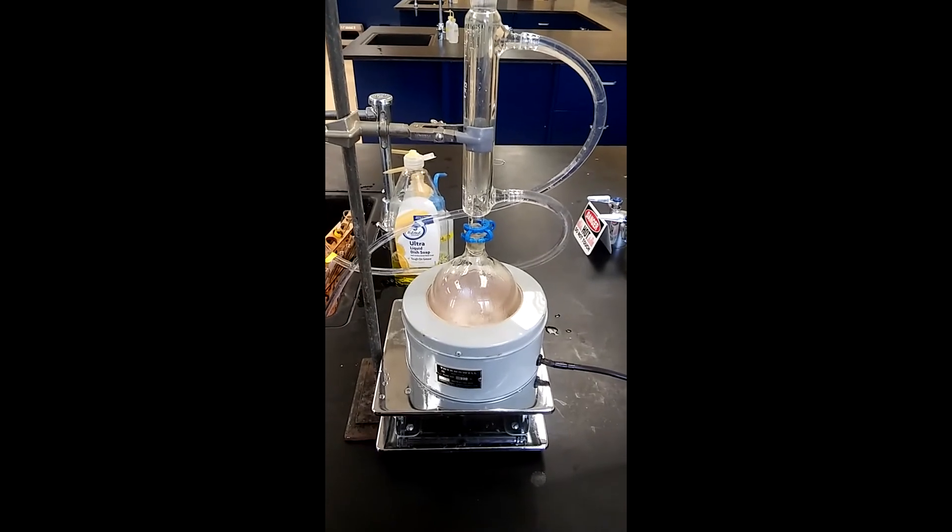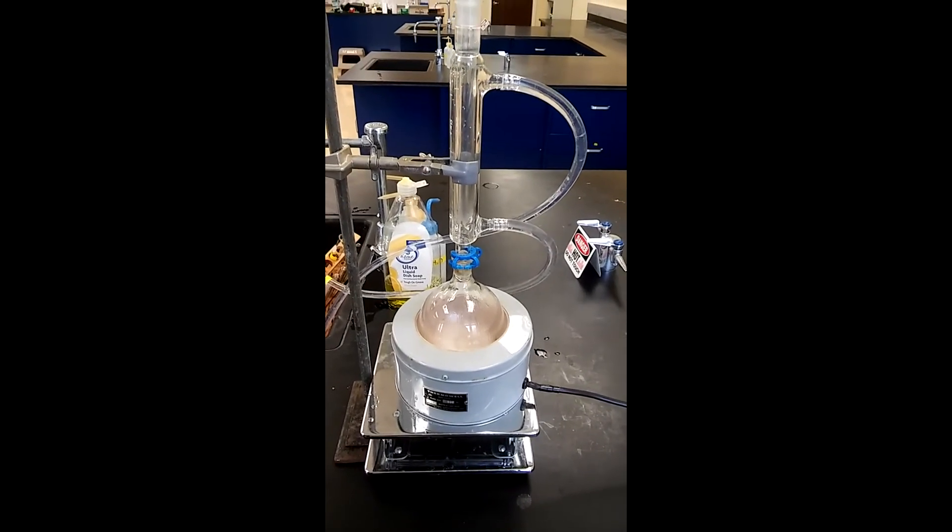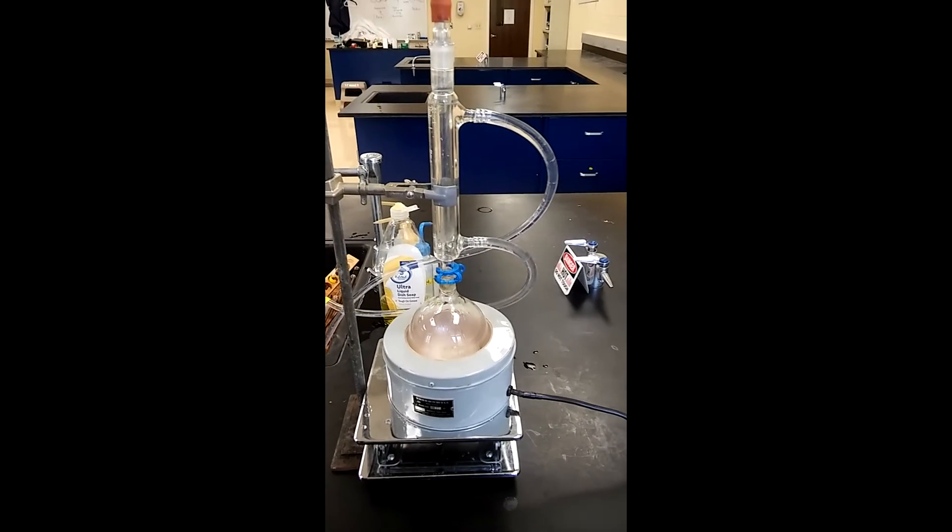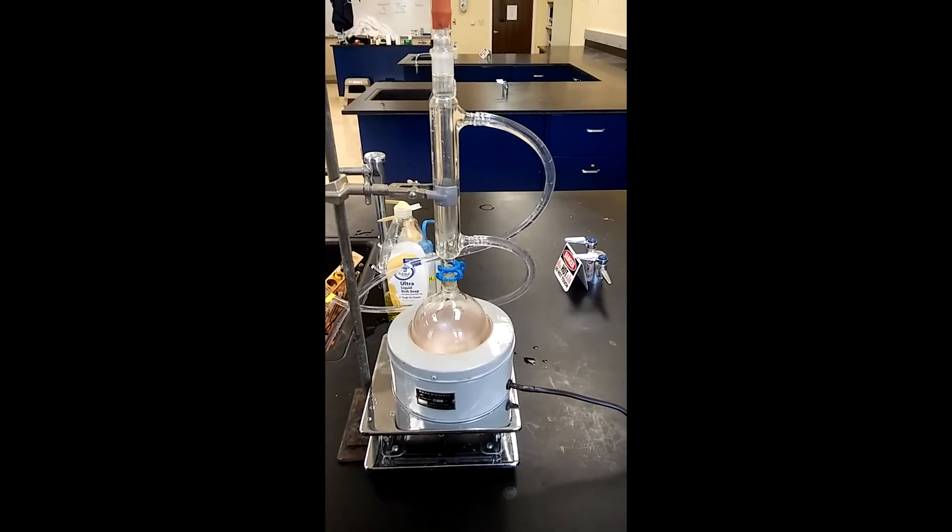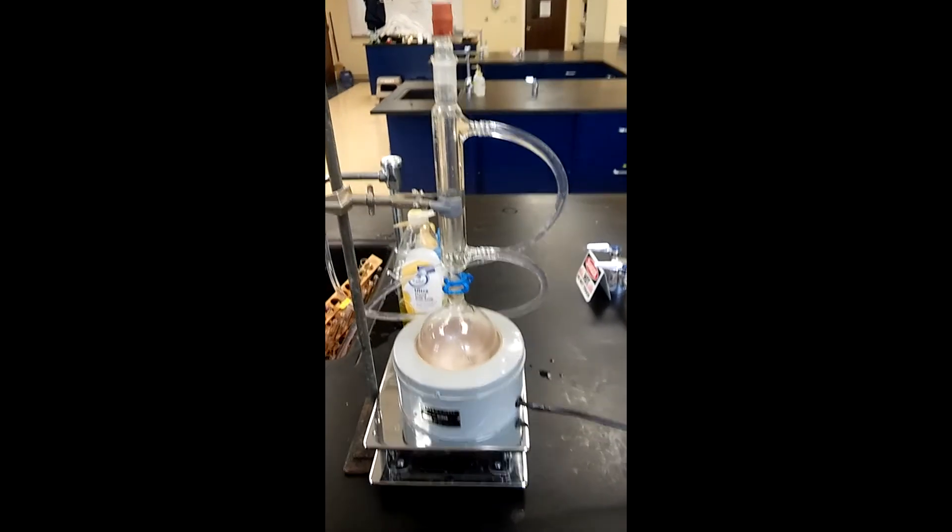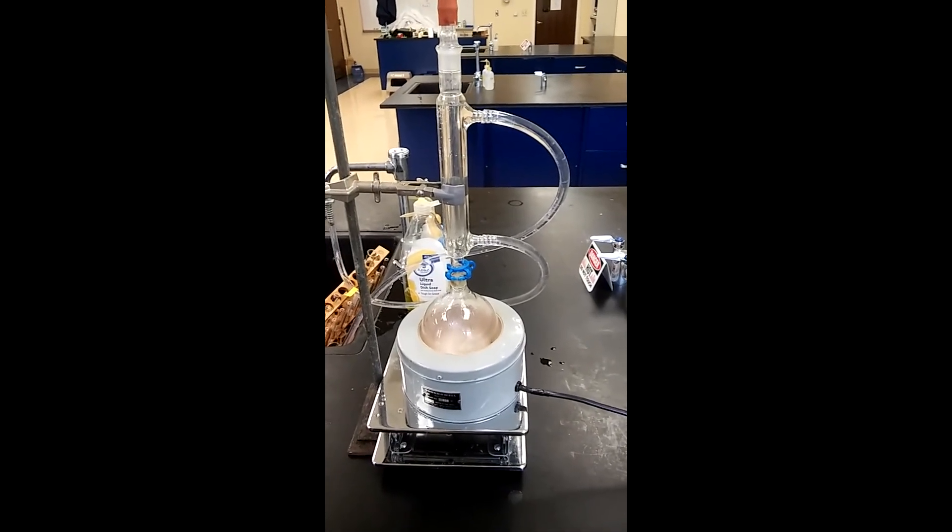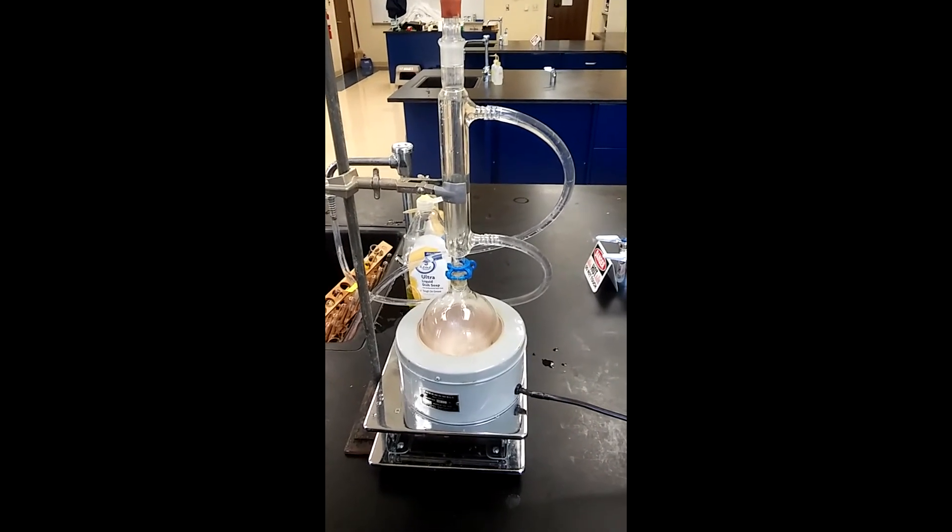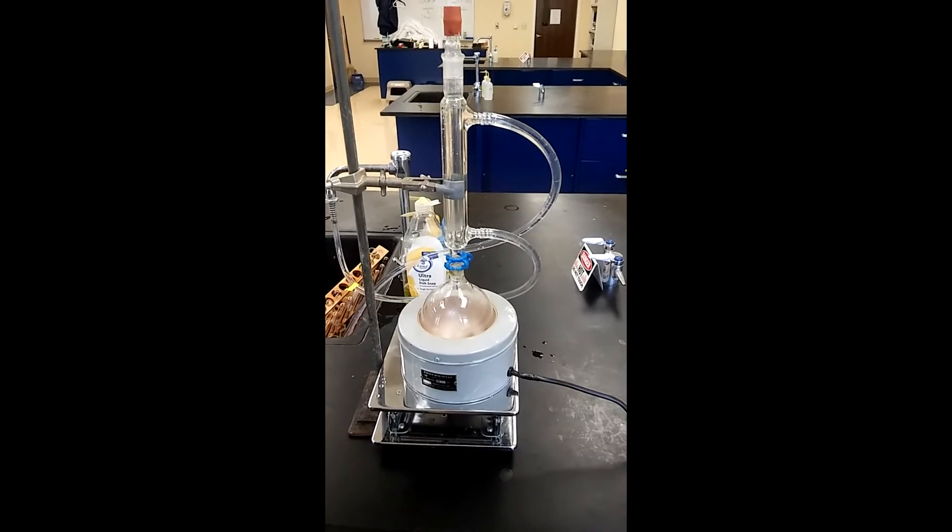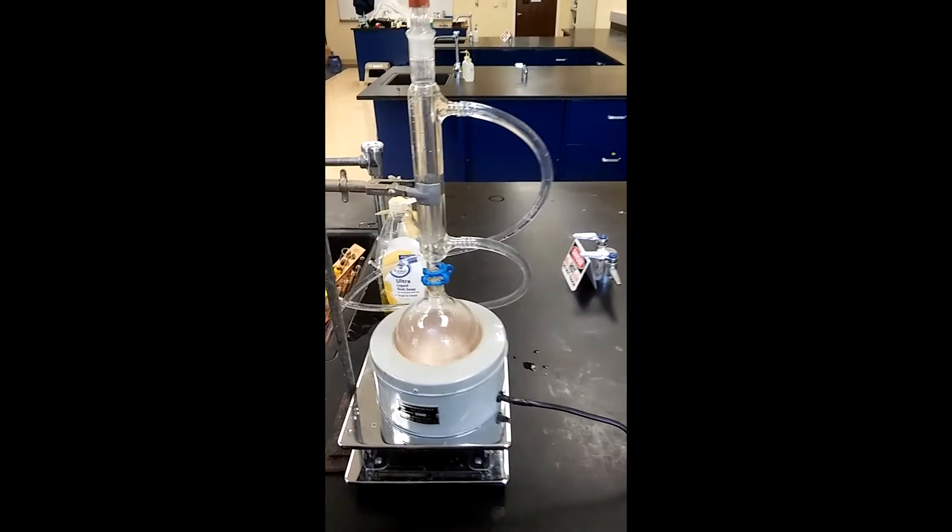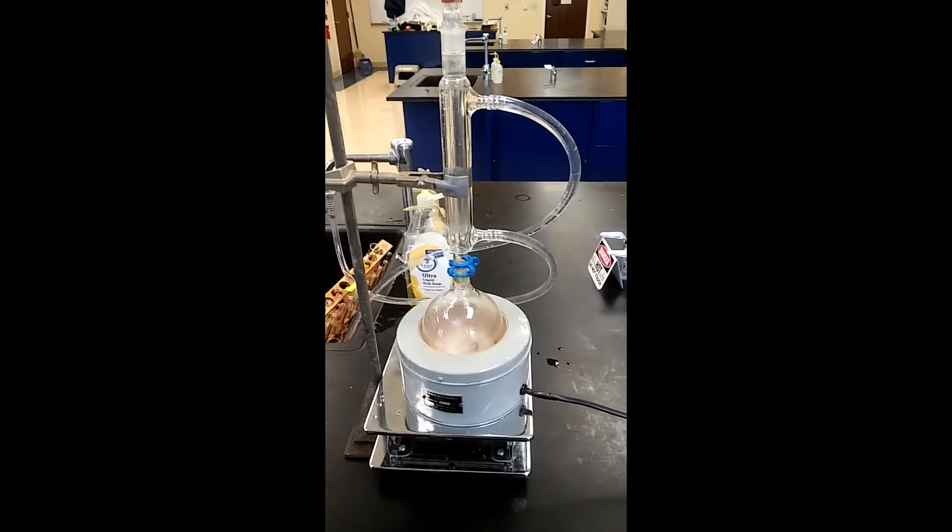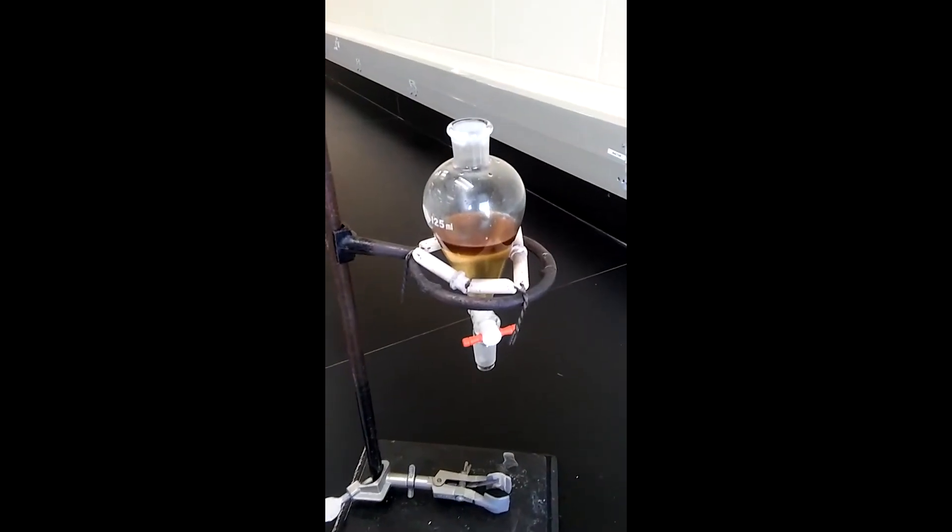Keep in mind the system's got to cool when done refluxing. You don't want to dismantle the round bottom flask when the system's hot because you pressurize the system. There's vapor and you really don't want to dismantle it when it's hot. Allow it to cool to room temperature and then dismantle the glassware, and then let it cool off completely before you put it in the separating funnel. I'll catch you back with the extraction procedure when it's ready.